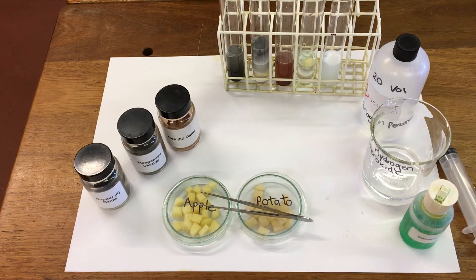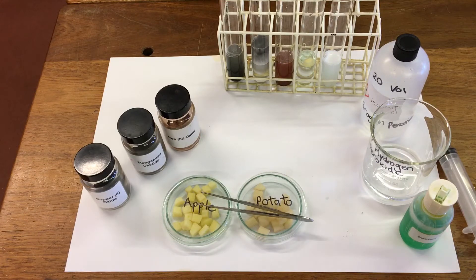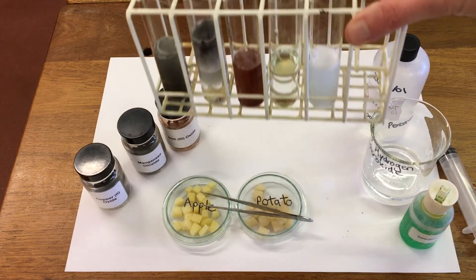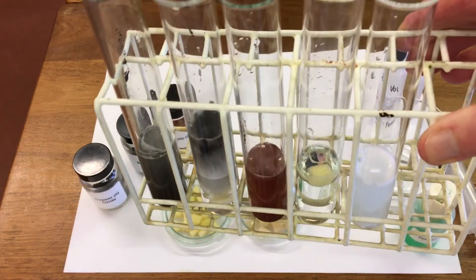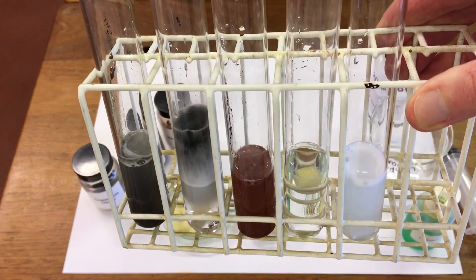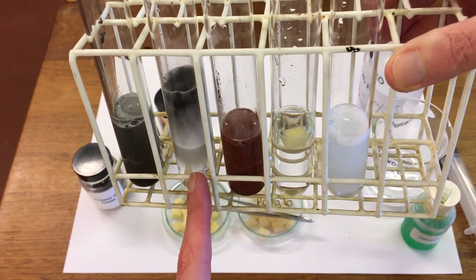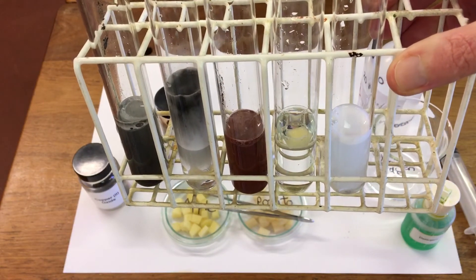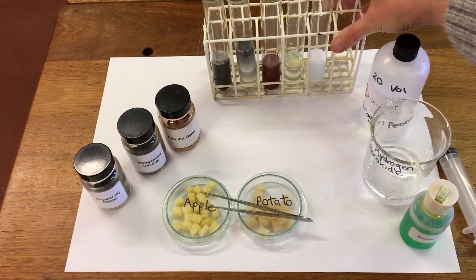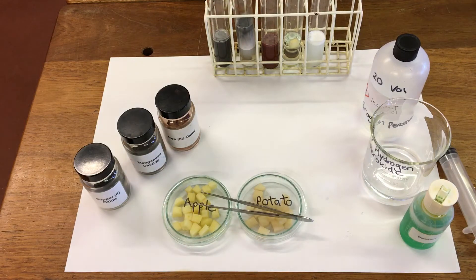To measure the speed of the reaction we can use a ruler and measure the height of bubbles. If we have a look initially, we can see the best catalyst at the moment is the manganese dioxide. So we can leave this for a couple of minutes and then measure the height of bubbles.